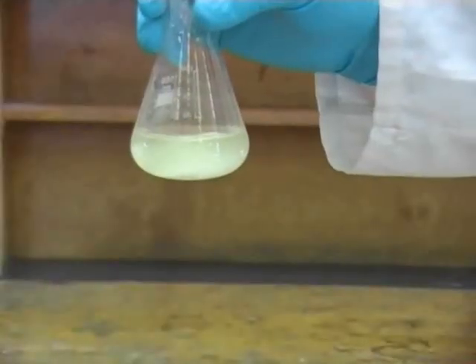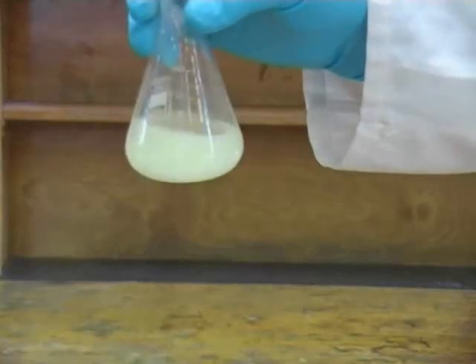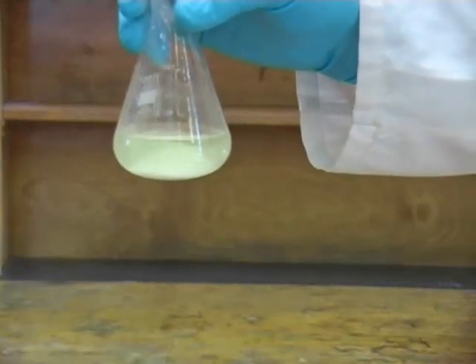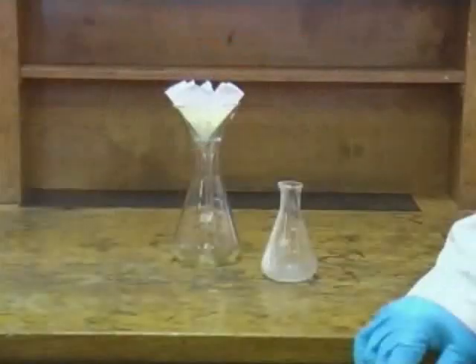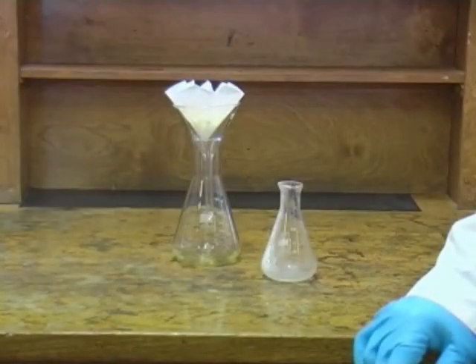When you can see a snowstorm effect like this you know that the solution is dry and that no more drying agent is needed. You can now remove the drying agent by gravity filtration before consulting the script once again to identify your next step.